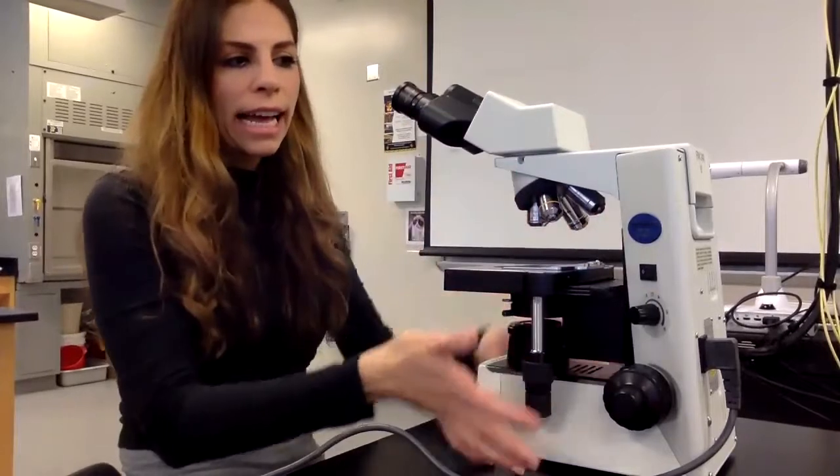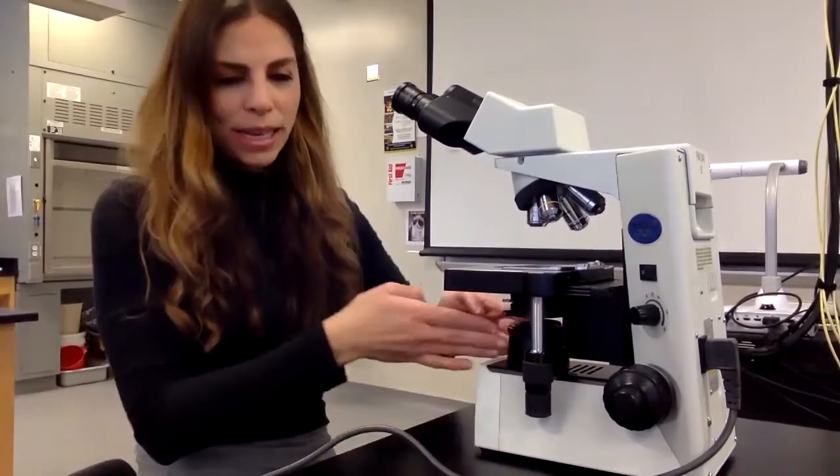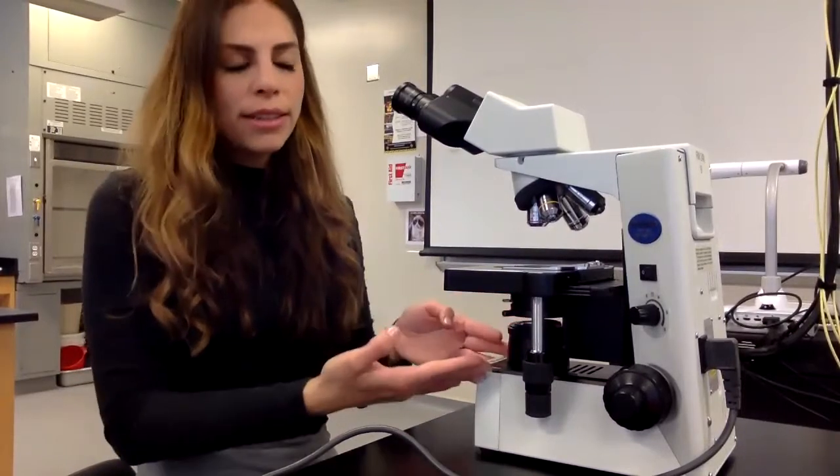Hi everyone, in this video I'm going to go over parts of a microscope. So right here I have a traditional light microscope, and it's called a light microscope because it uses a light source. I'm going to start off by demonstrating how we carry a light microscope.